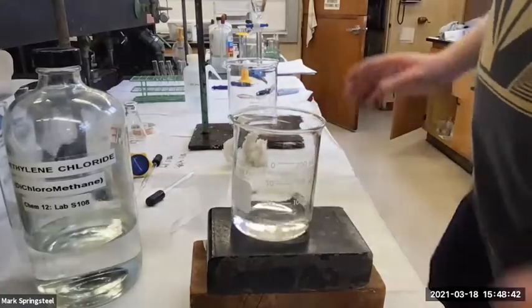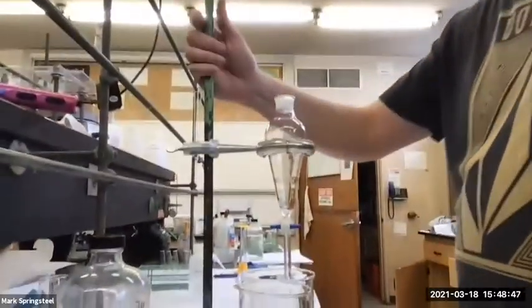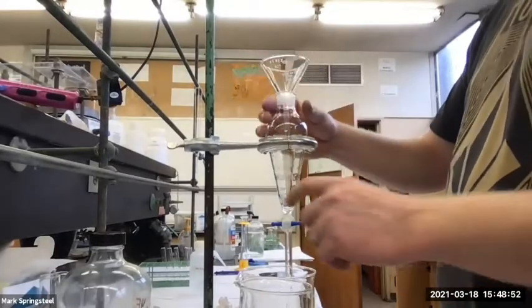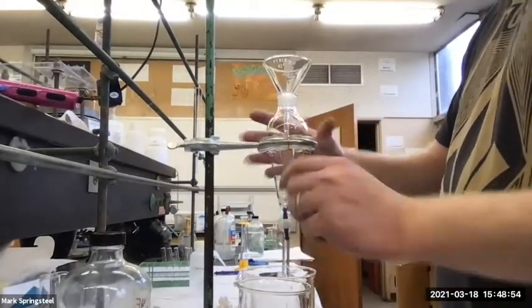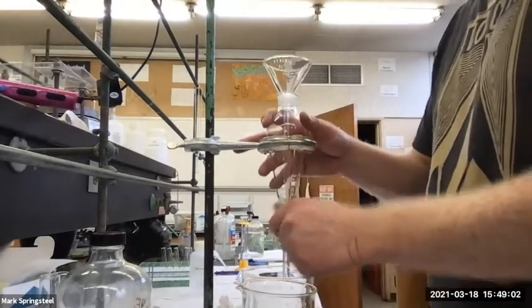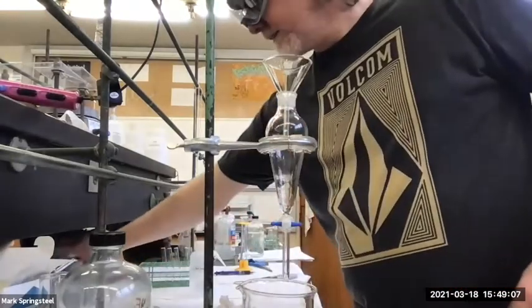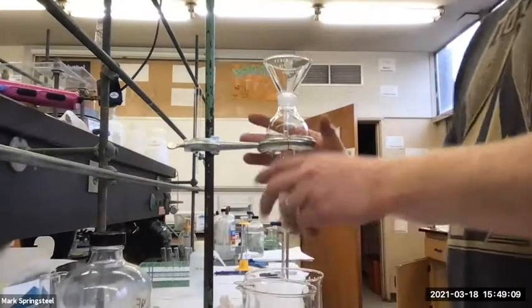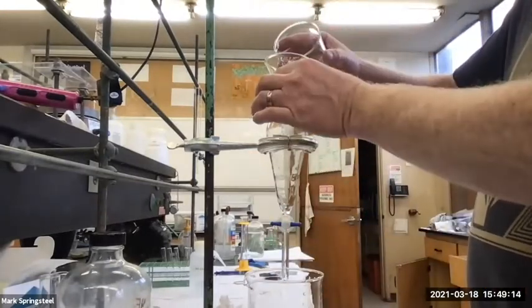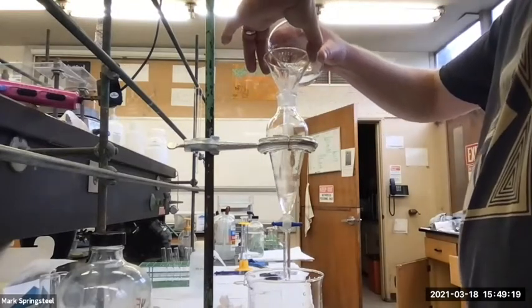Got it all there. And then I'm going to add it to my separatory funnel. So my separatory funnel here, I'll open it up at the bottom. And should I pour it in while it's open at the bottom? No. Get it all over your countertop. Close it. There's a little bit of water. I do have my security blanket there, just in case I make a mistake, but I'm not going to do that. I'm going to just carefully pour this in. If I want, I can lift it up slightly too, so air can come out as it fills.